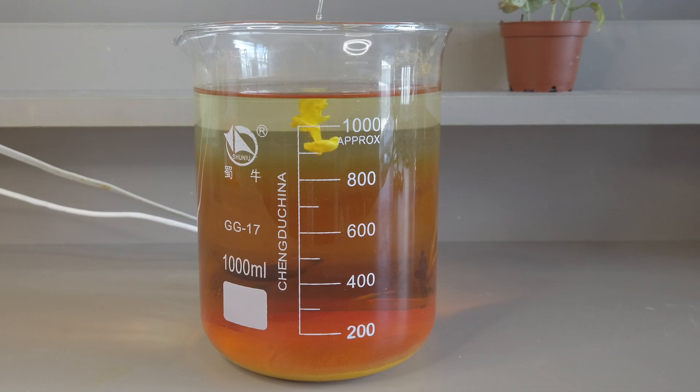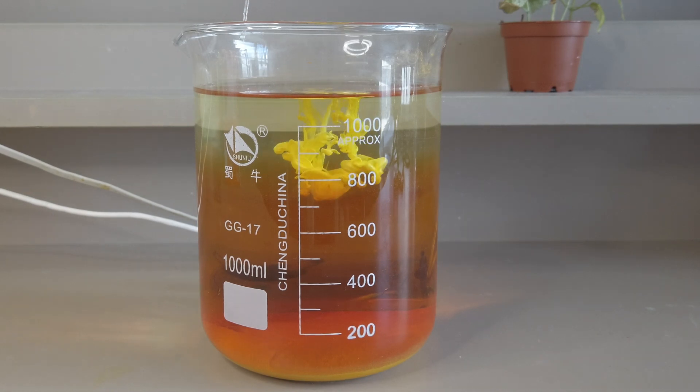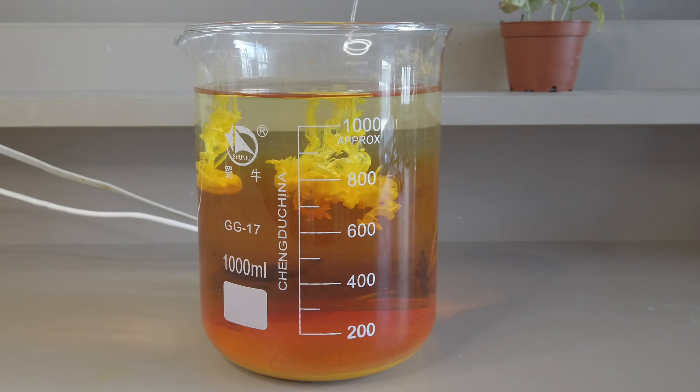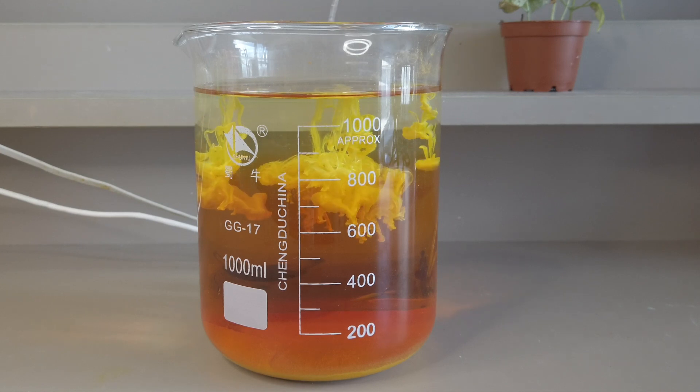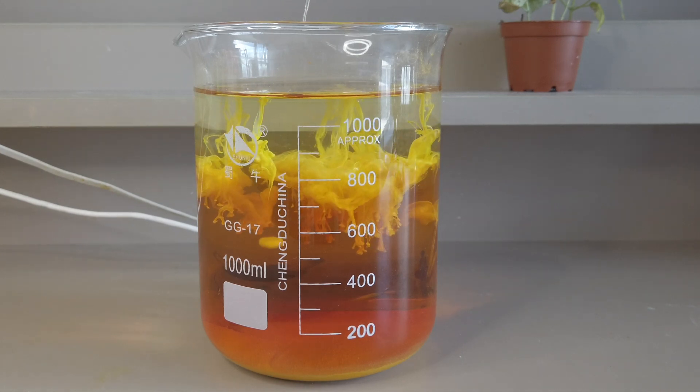We actually tried doing it on a larger scale, but it failed miserably. Though the precipitation reaction itself is very enjoyable to watch.